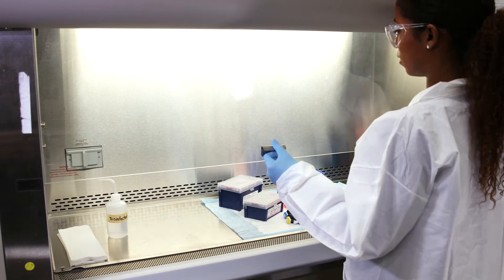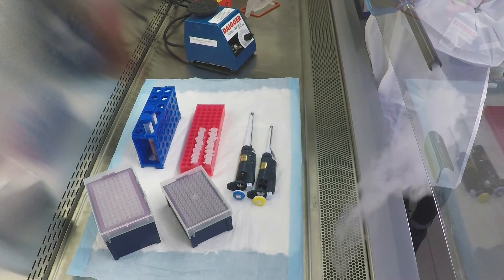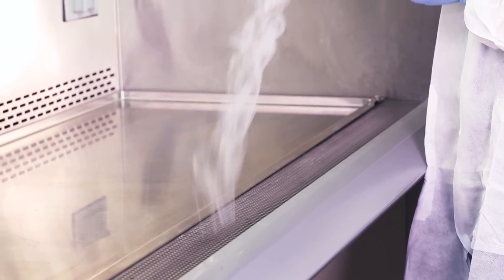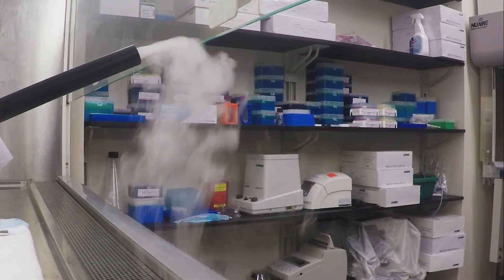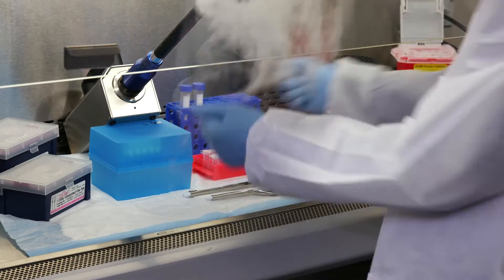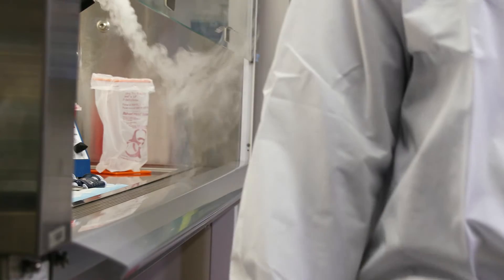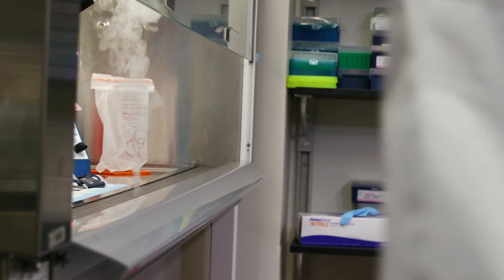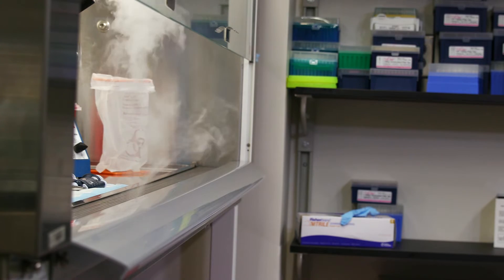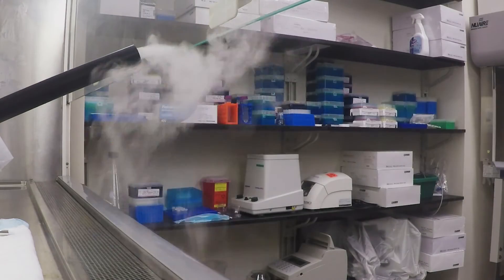Even when the sash height is correct, the air barrier at the opening is fragile — approximately 100 feet per minute or 1 mile per hour — and it can be easily disrupted. Something as simple as the way you withdraw your arms, or a person walking too close to the cabinet, can pull air and potential contaminants out of the cabinet and into the breathing zone of the person working in the BSC.